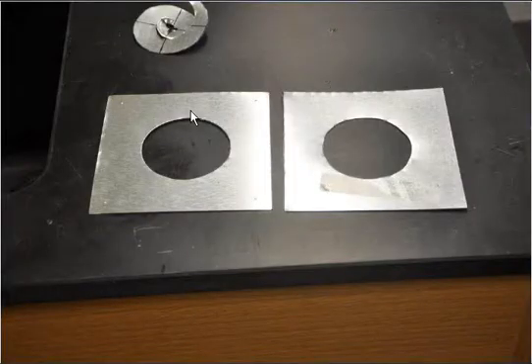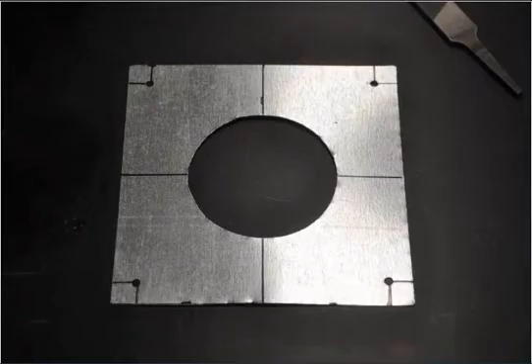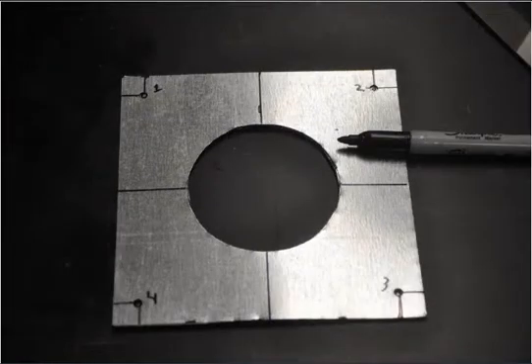So you want to do this process twice. We're going to make two plates, same size, with an 80 millimeter diameter hole in the center. Then we're going to mark the corners and drill a hole in each corner. These are half an inch away from the edge. I know I switch my measurement units back and forth, but some things are easier to do in inches for me, and some things are easier in millimeters. So then we're going to line up.